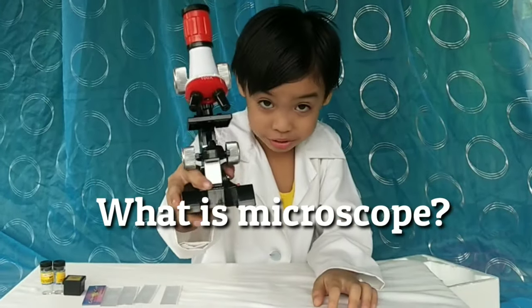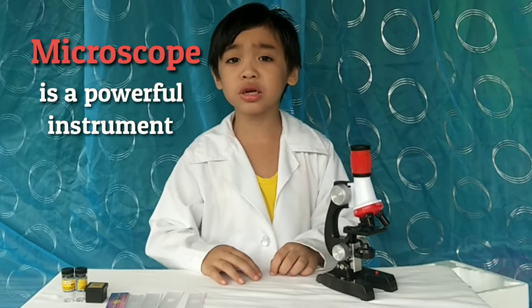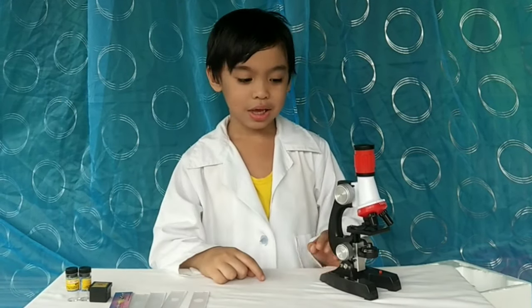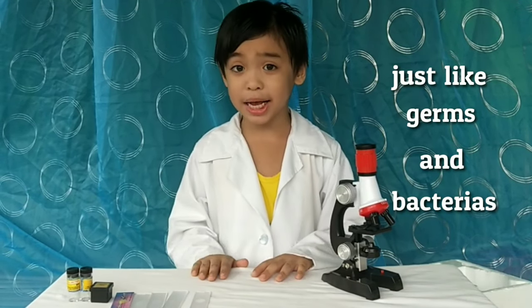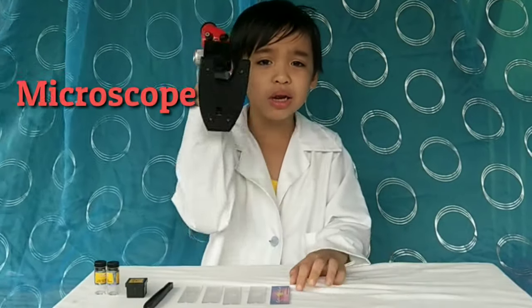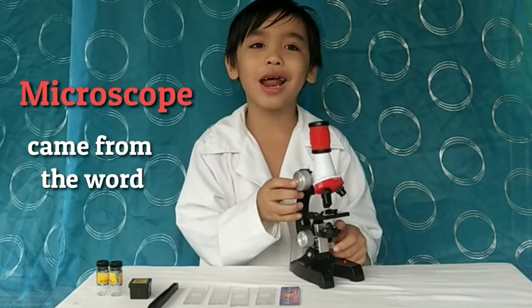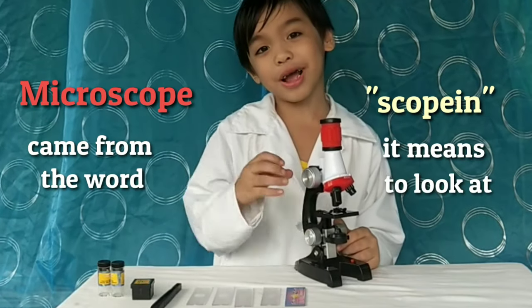What is a microscope? The microscope is a powerful instrument to see many tiny things around us, like germs and bacteria, and many more! The microscope came from the word 'micron.' It means small, and 'scopin' means to look at.